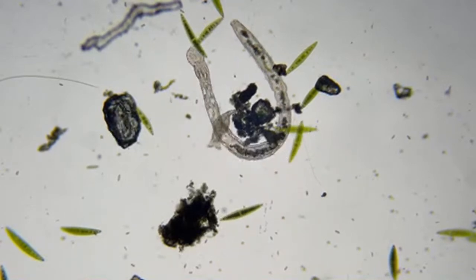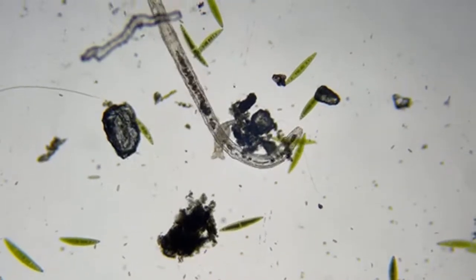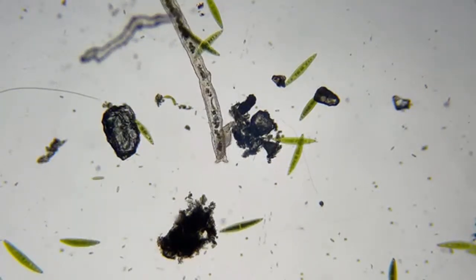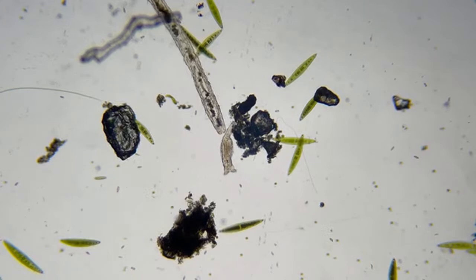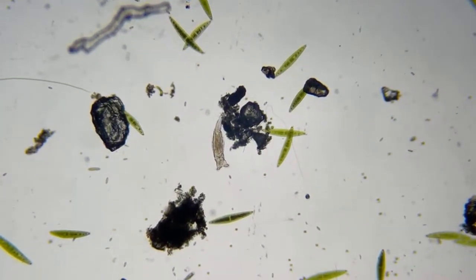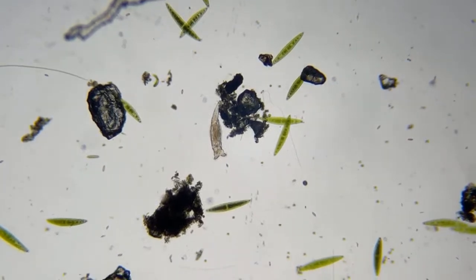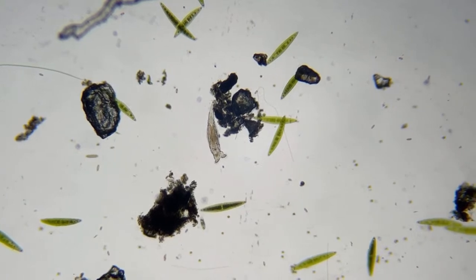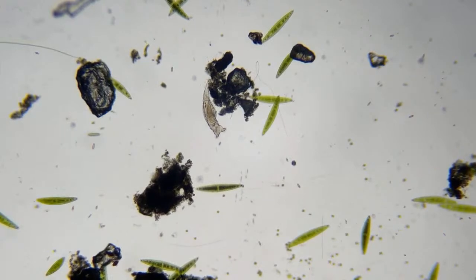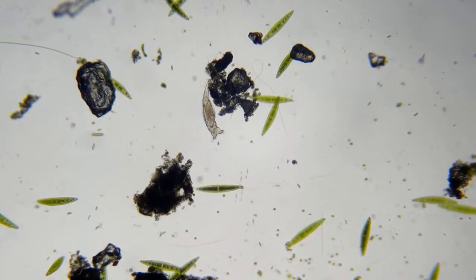This microscope's a regular light microscope, and it's called an Acuscope 3000 LED. It's fairly expensive for amateur microscopes. I think I paid $750 for it a few years back. I think for some reason now, inflation maybe, it's up to $1,200. So I really got a deal on it. And with donations from people, you guys donated, I was able to get phase contrast on it. And I bought a couple of polarizers.